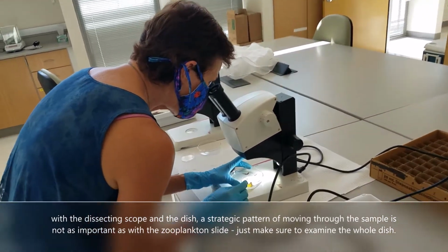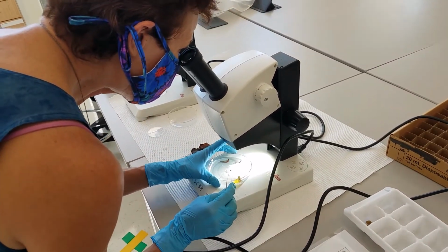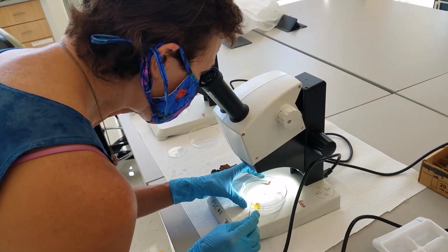And little bits of plant matter, but I'm not seeing anything in this particular sample.